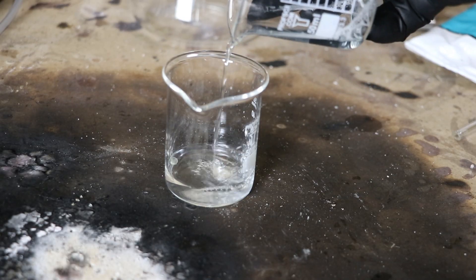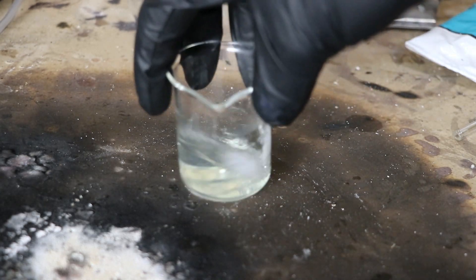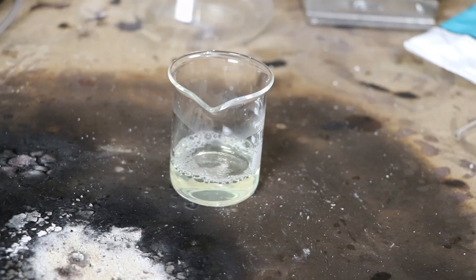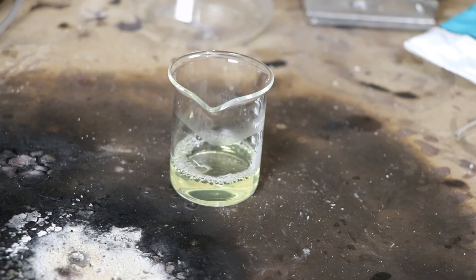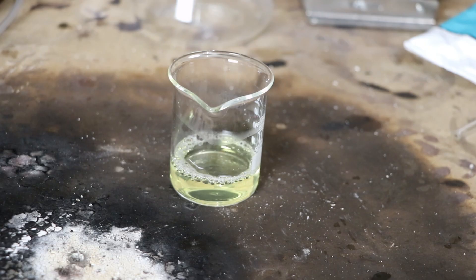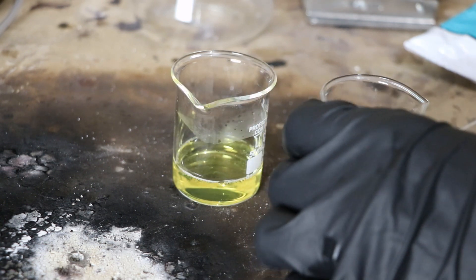So let's see what happens here. If there's peroxide present, we should see a color change to brown. Okay. Now we should see some oxygen gas being liberated. It's not foaming up like I would expect. Hmm. The color change was correct. Maybe my test is off.